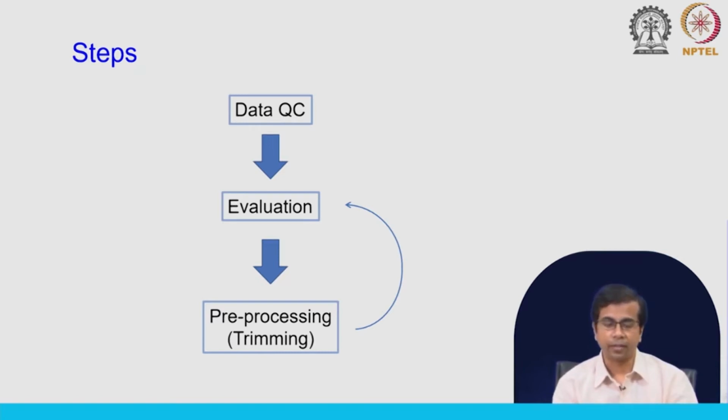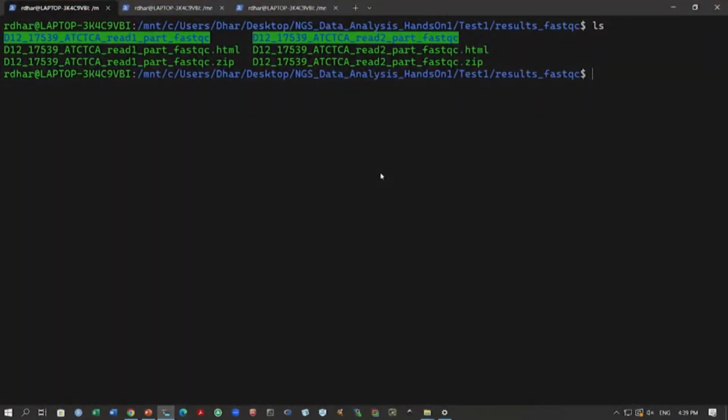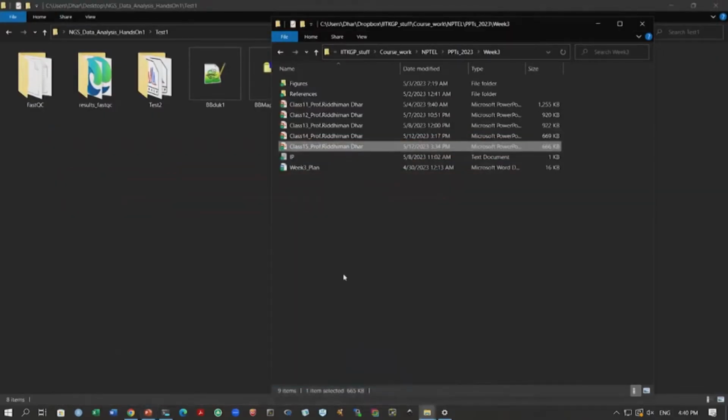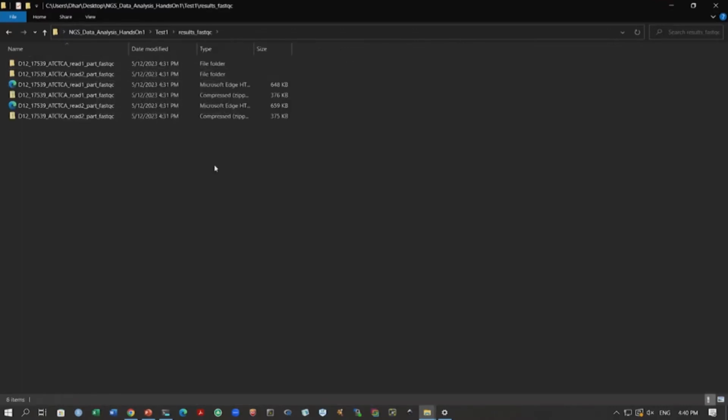So, let us move into the terminal, where we have generated the quality control. If you remember, in the last class we discussed how we generate these quality control results using FastQC. We ran the command, and inside this results FastQC folder we have moved all the results for these two files, read 1 and read 2. We have extracted these results, and now we will look into them, make our evaluation, and then continue with pre-processing if required. So, let us go inside the folder now. Inside this folder we will see the results. This is results FastQC, and we have extracted this.